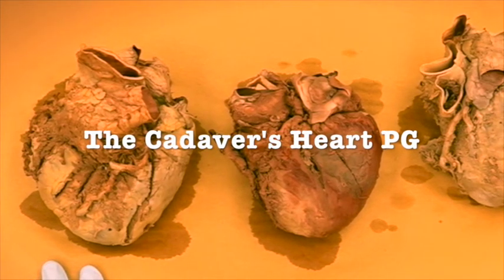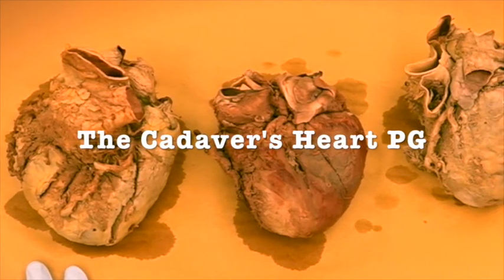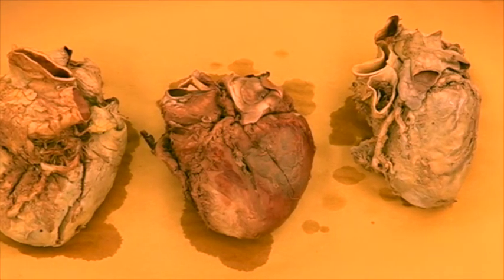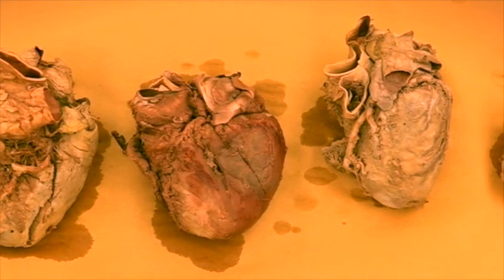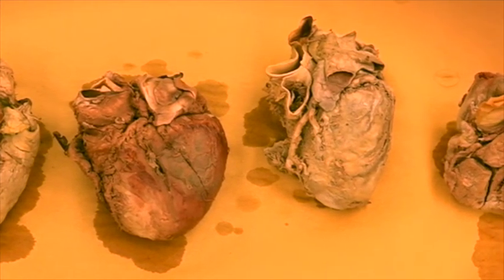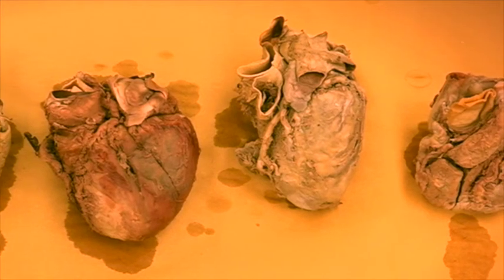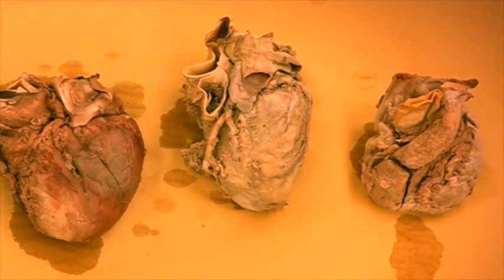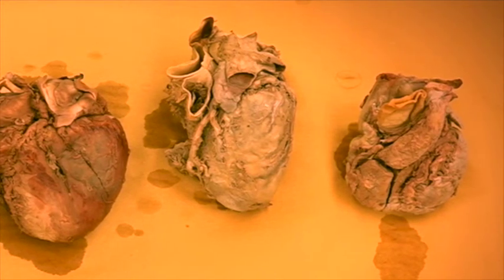This video is intended to demonstrate the steps involved in evaluating an embalmed cadaver's heart for pathology. It is intended to accompany the cadaver's heart PG laboratory guide. After removing the heart from the cadaver in which you have dissected, be sure to ask your instructor whether it is okay to section the heart before proceeding.